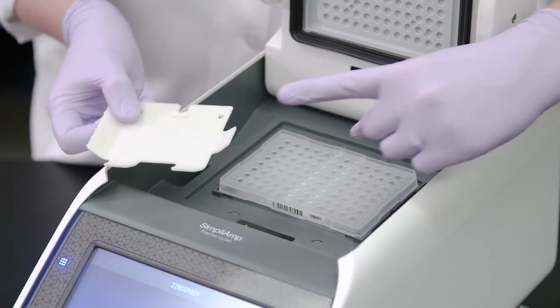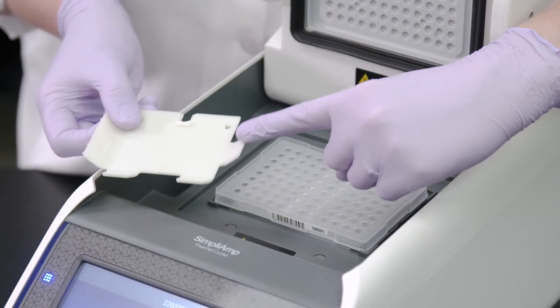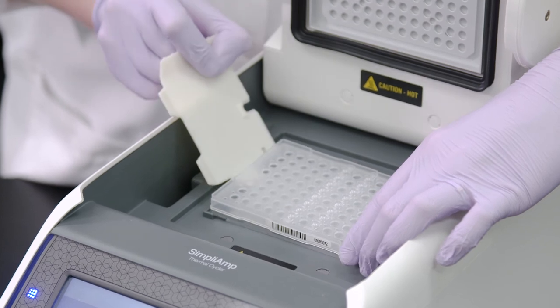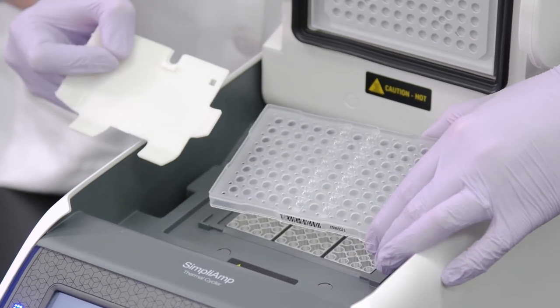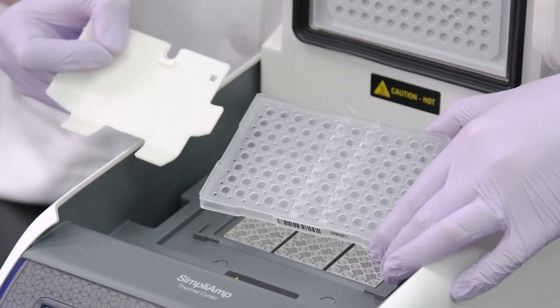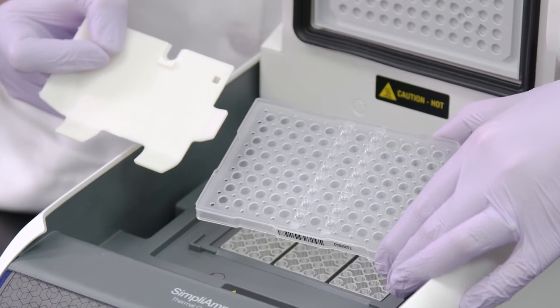Based on the design and access to varying thermal cyclers, you can also insert the single-prong side of the multi-removal tool into the short side of the plate and lift to remove the plate from the sample block.